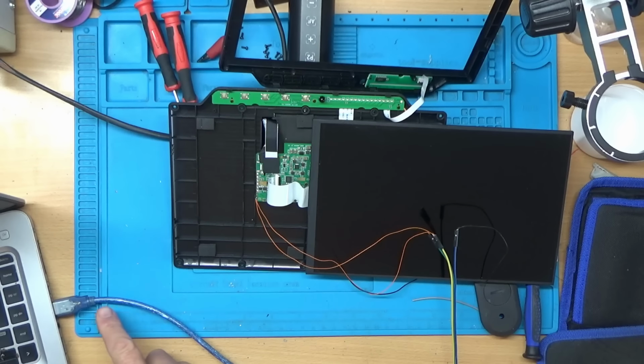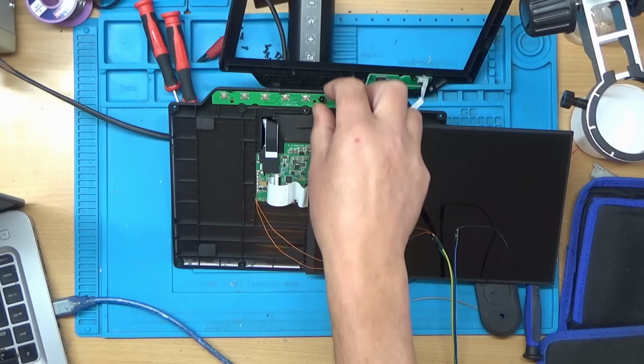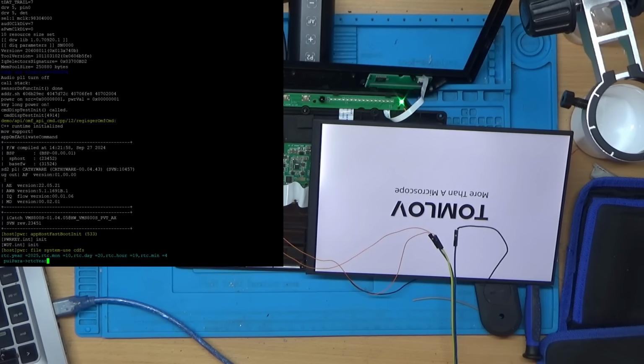Right, I've got it plugged into the laptop via the USB. I've got the wires connected up here. So let's switch it on and let's see what we get on the laptop screen, if anything. And we do indeed get something.